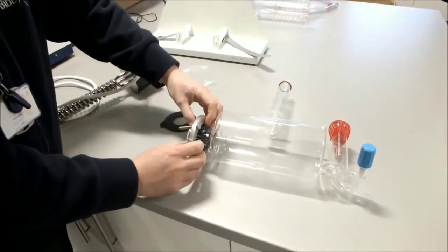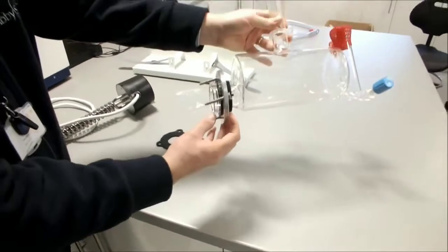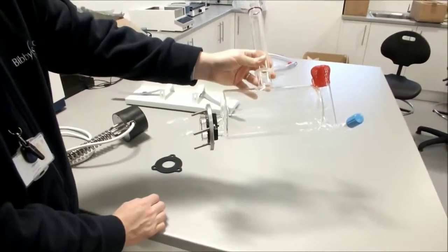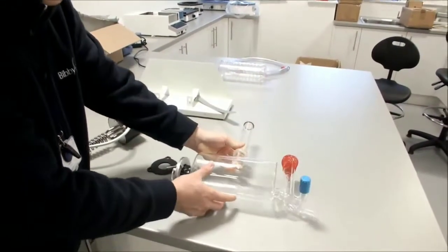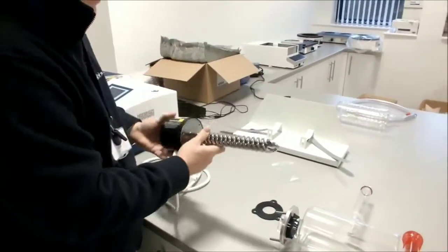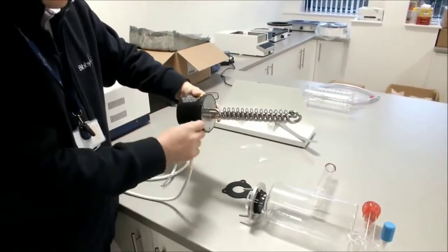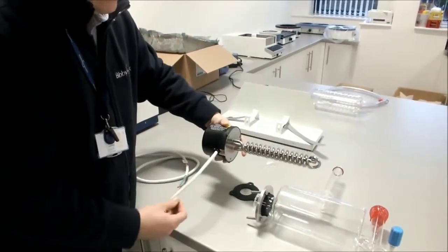You then pull the flange and the plastic insert to the end of the boiler. Next thing is to take your heater. Now it's important that the reset buttons are at the top and the cable comes out the bottom like so.